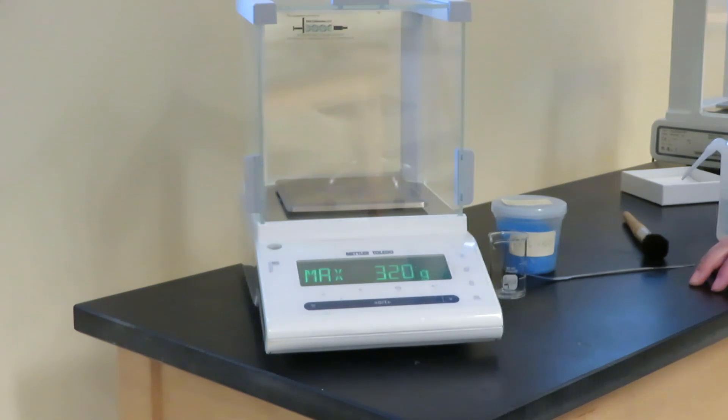We've calculated the concentration of our unknown solution and we've determined the mass that we want to weigh for our 25 milliliter solution that is the same concentration as the unknown.